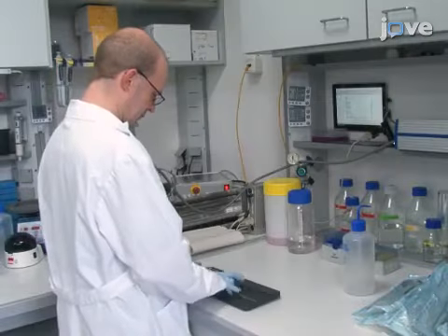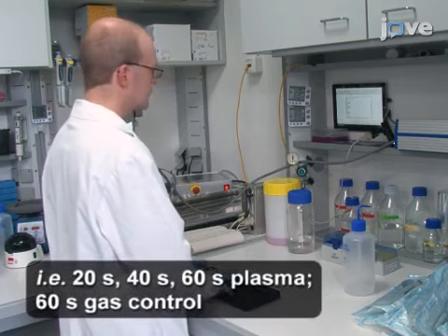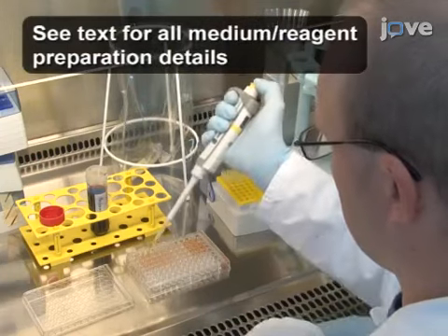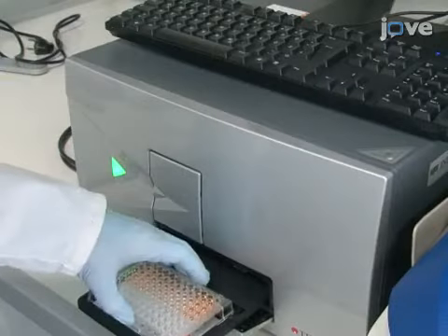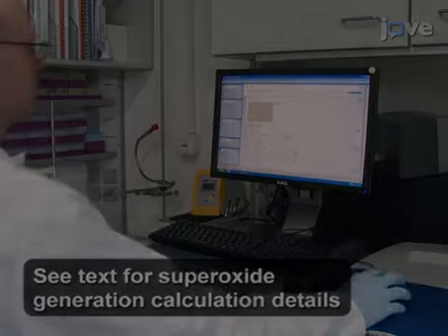For plasma-treated superoxide analysis, set up a final protocol for the XYZ table with the appropriate respective treatment times and well positions. Then, add 100 microliters of freshly prepared master mix to the wells of a clear, flat-bottom 96 well plate in triplicate, and use a microplate reader to measure the absorbance at 550 nanometers.